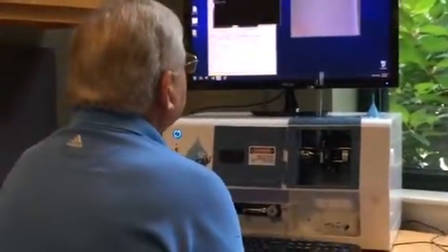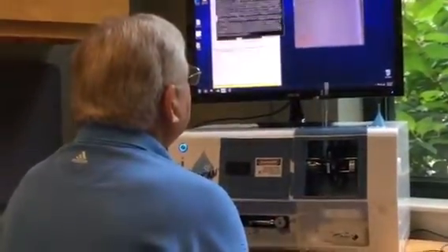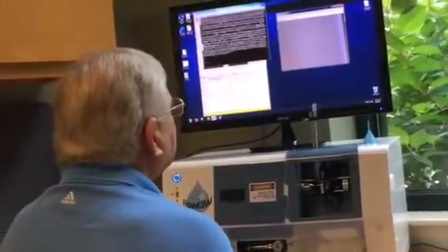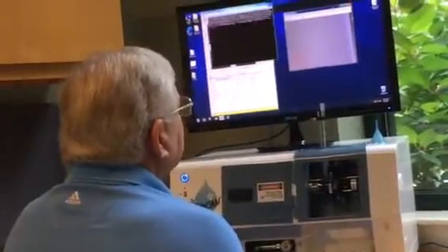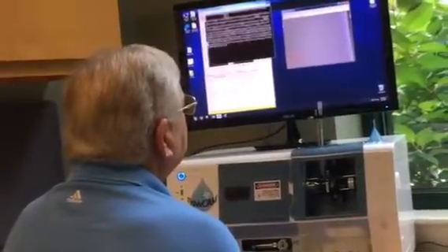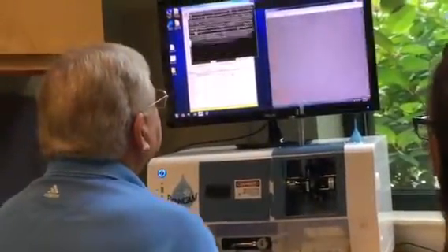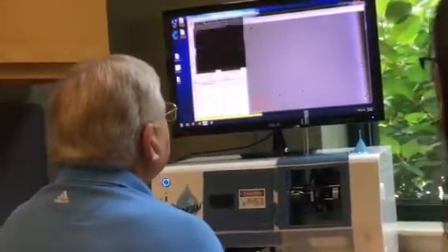Wow. Big chunk. Bingo. So the big chunks are a little tricky because they have a very different flow rate. And so you'll see that occasionally you get duplicate images of them. Oh, okay, right. So just keep an eye out for that when you're doing your counts. You have such a low number of them relative to the other particles that it's not going to have a drastic effect on your data. Another thing we can do here is zoom this in and make this window a little bit bigger, particularly if you're focusing, and it can make it a little bit easier.